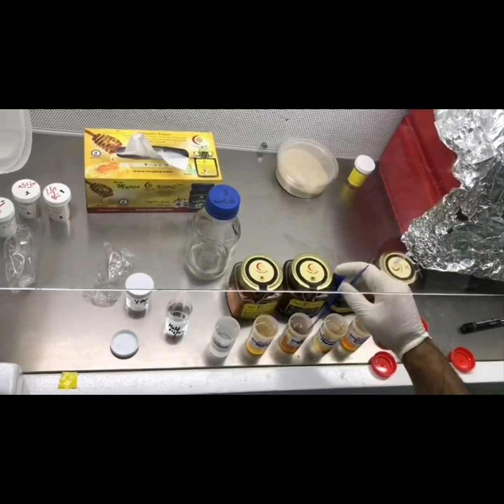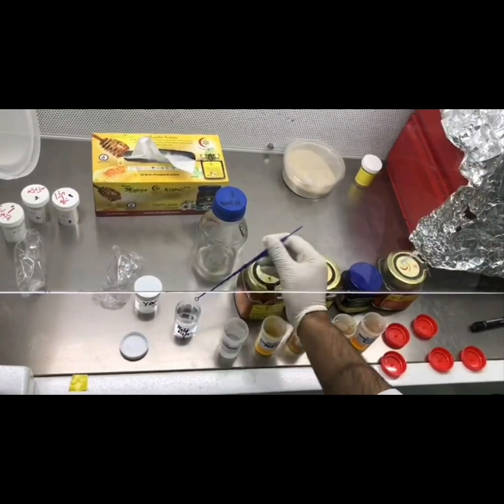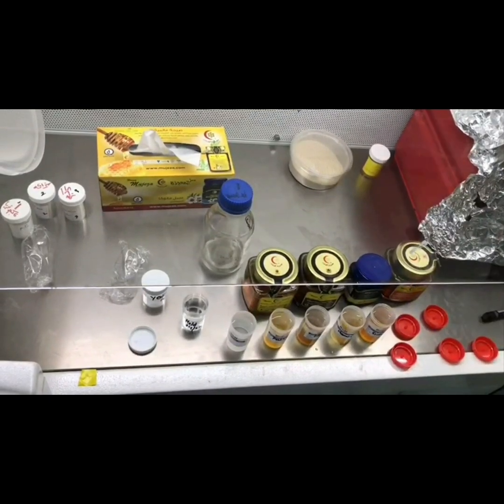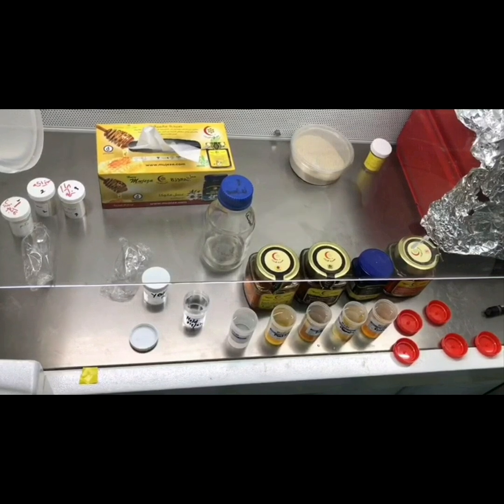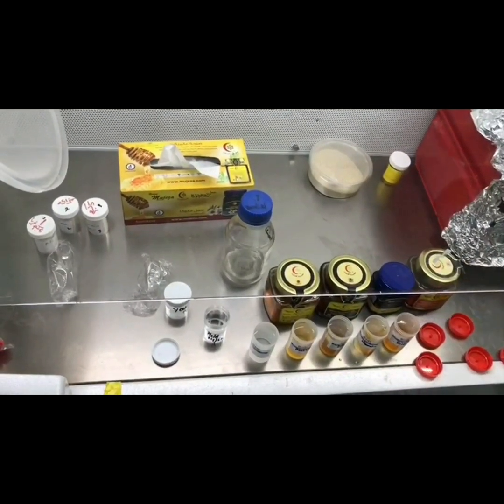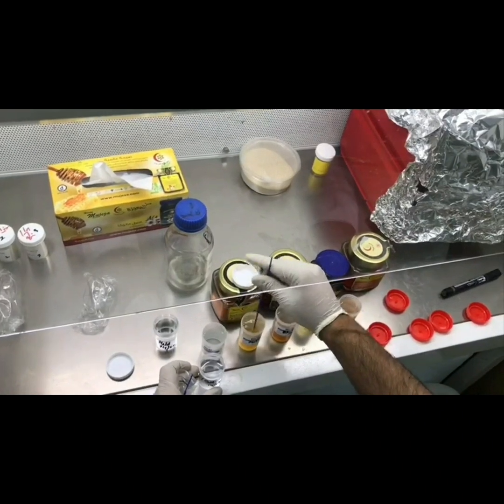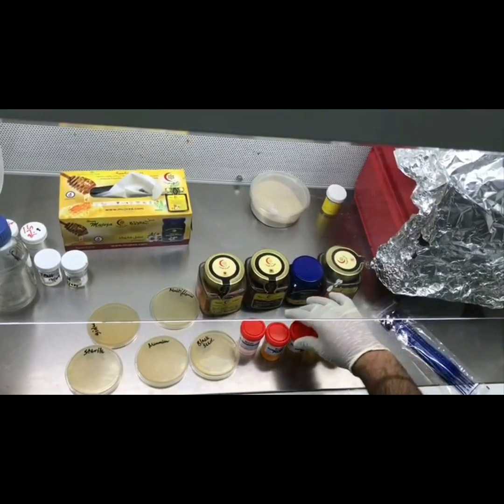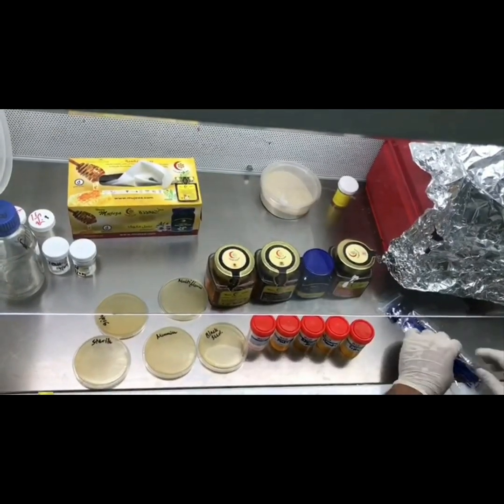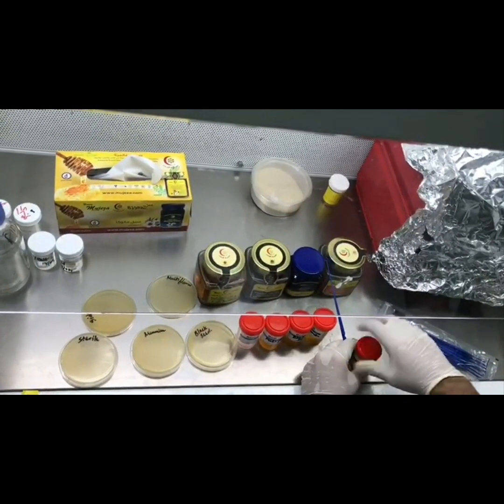Then I will transfer mold to black seed honey, then to manuka honey. The same way I'm going to transfer the yeast also — to the multi-flower honey and to the rest of the honeys. We have now transferred the microbes into all the containers with different honeys, and we will spread each one on a petri plate to see the effect of the honey.